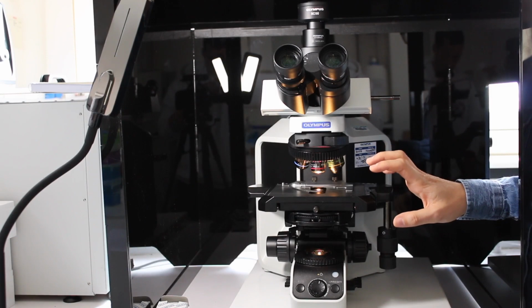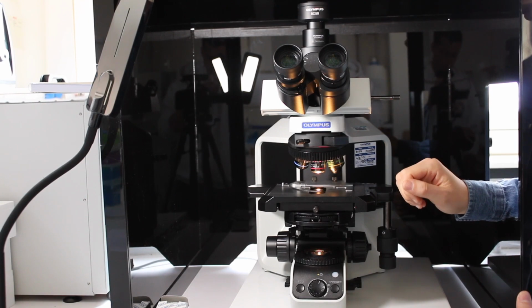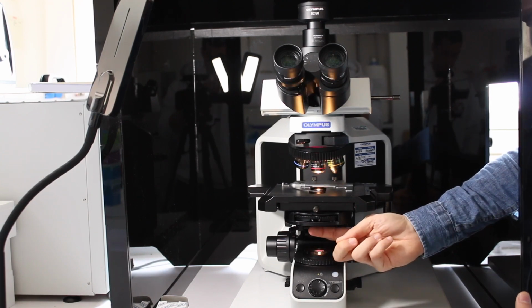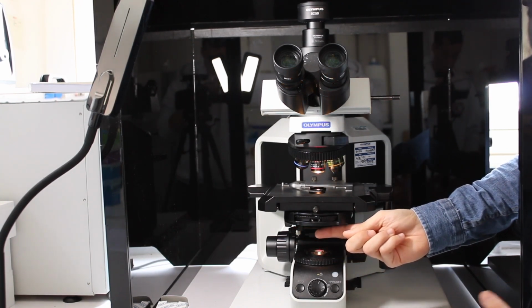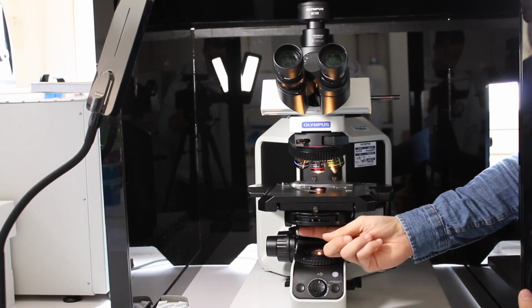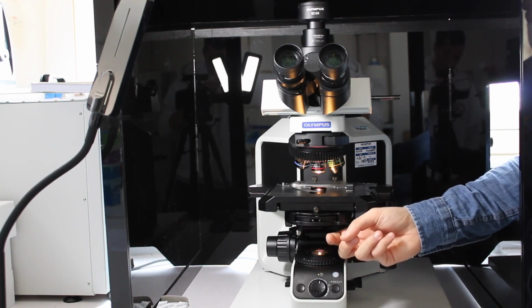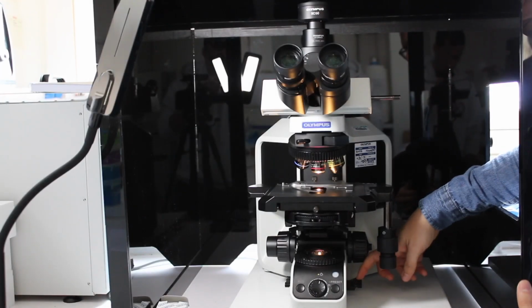Then there are 2 additional diaphragms that you can close to reduce the light intensity or to optimize the contrast of your sample. One is at the bottom here. This basically just closes the diaphragm, from open to closed. And there is another one just below the wheel here that will usually improve the contrast of the sample, so you can decrease that. This diaphragm only works for bright field mode. If you're in phase contrast or dark field, it will automatically be open. There is a spring that will automatically open this diaphragm because you will need to collect as much light as possible.